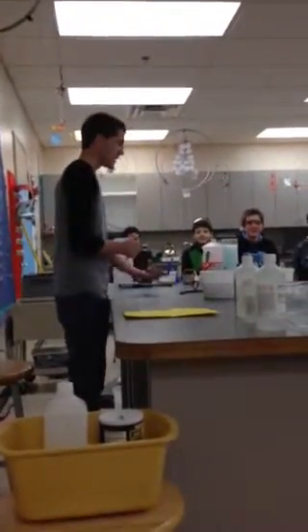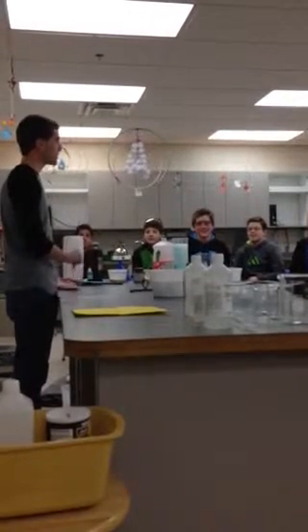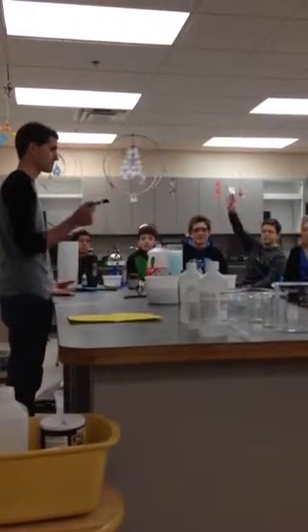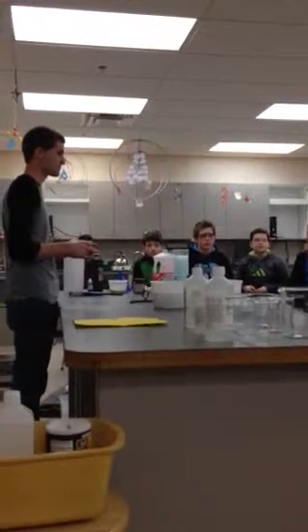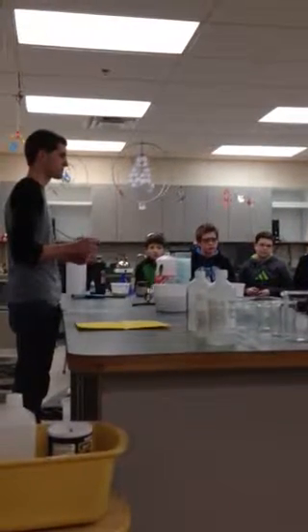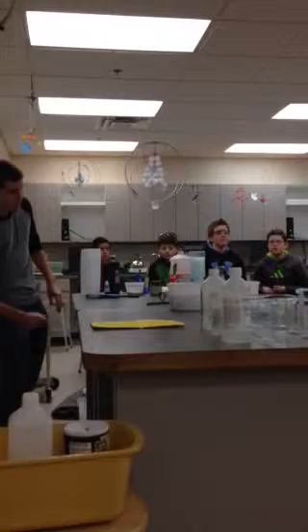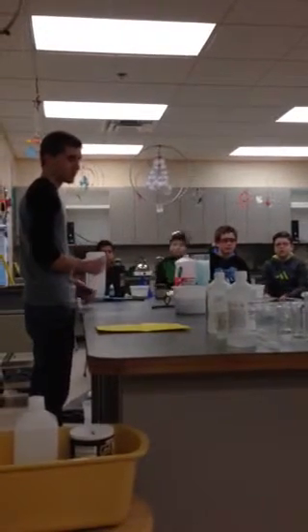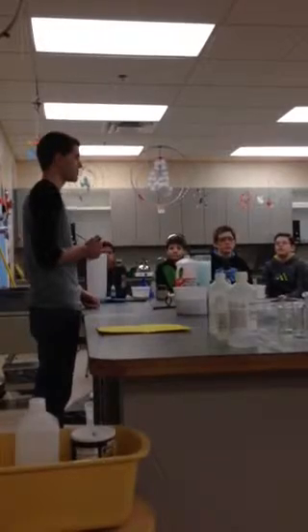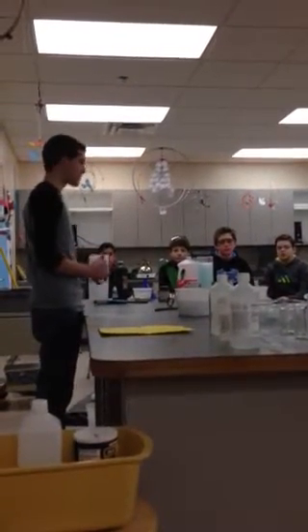Now, I've got a question for you. Why did the dollar bill not burn? Because the chemicals that were layered on the outside were the ones that caught on fire, and the bill was underneath all those chemicals where it didn't affect it at all. That's pretty much right. I had isopropyl alcohol, like we've used before, which is extremely flammable, mixed with a mixture of water and salt. The salt was added to add more color to the flame.